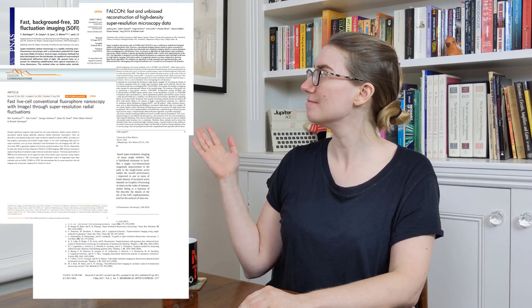Unsurprisingly, a lot of people decided it would be a very good idea to be able to use this sort of data, including me. There have been a lot of papers published on it. What these methods all have in common is they try to achieve a result better than single emitter fitting by building more information into the model. A simple fit just has information about a single point spread function shape, but we can include, for example, how many fluorophores we think are in an overlapping patch if we know something about the number of photons a fluorophore is likely to emit. Or we can use the fact that fluorophores blink on and off, that is, use information from the time domain. However, what I became interested in is that all of these methods, including simple single molecule fitting, run into a fundamental problem.